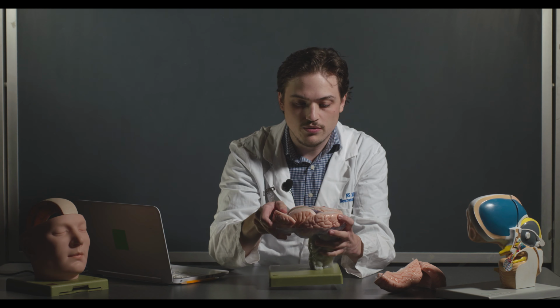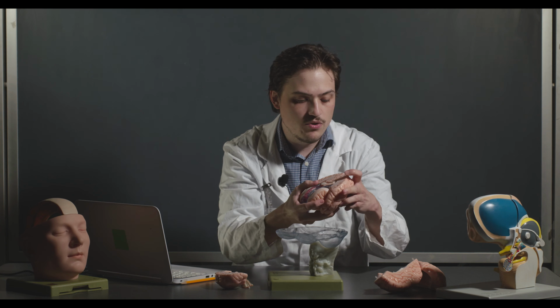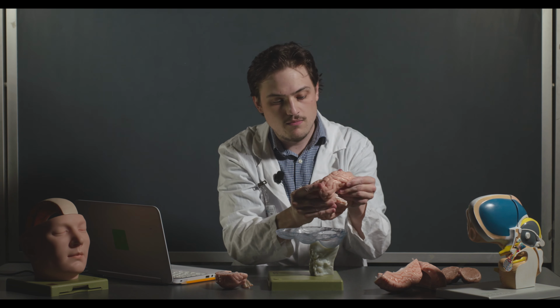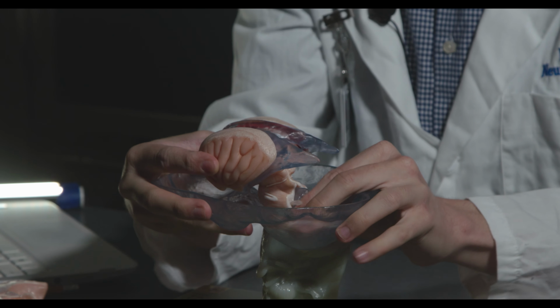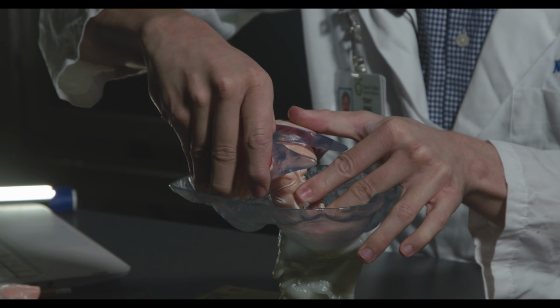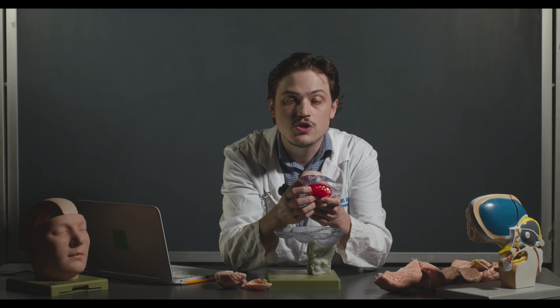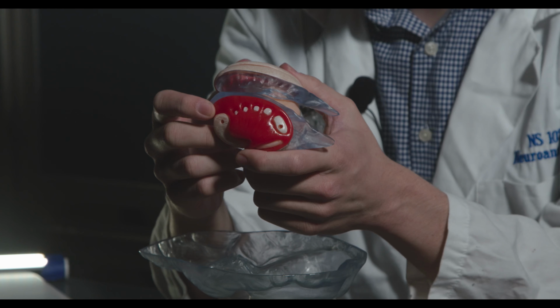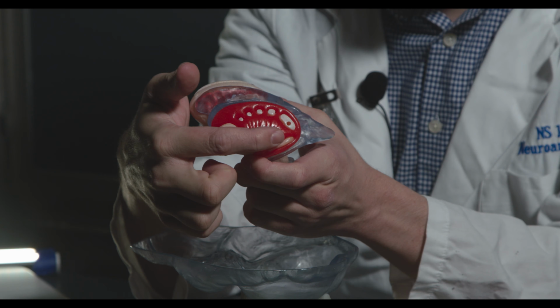I'm going to pull this out a little bit more so we can talk about it. I'm going to remove the cerebellum and more of these structures. All right. So more or less, these are the structures we're going to get to, and I'll remove the insular cortex here so you can see some of these structures more specifically. The first structure that we are going to show in the actual sheep brain today is the basal ganglia. You can see some of the structures of the basal ganglia here. Here is the caudate, and right here is the putamen.